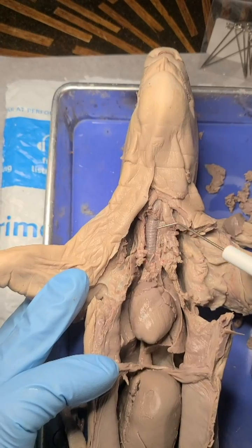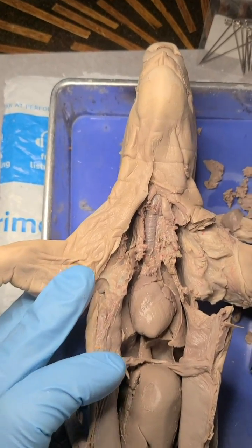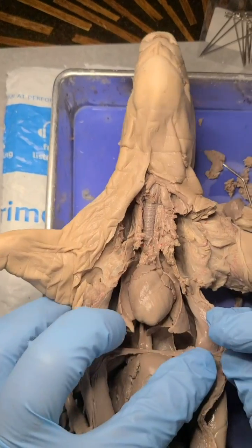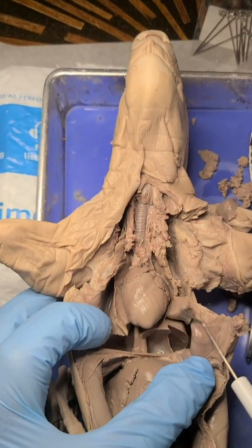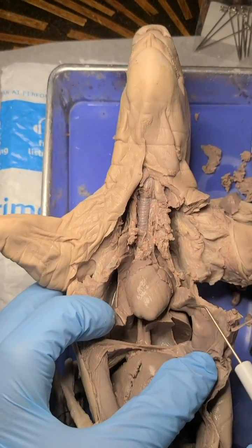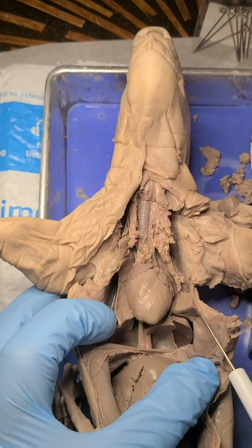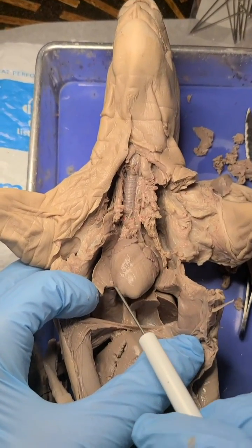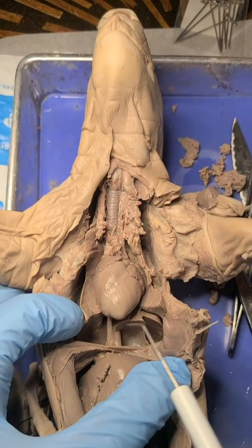This trachea is going to branch into two main branches and deliver air into the lungs. The lungs are these lobes right here — it's a very spongy tissue, and we'll see what it looks like under the microscope.